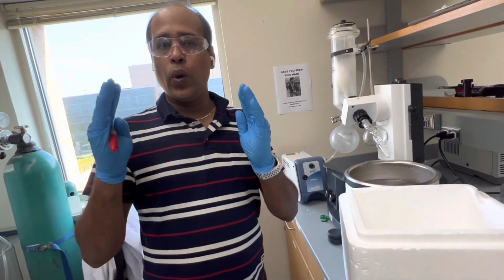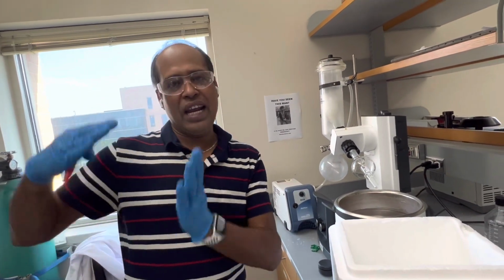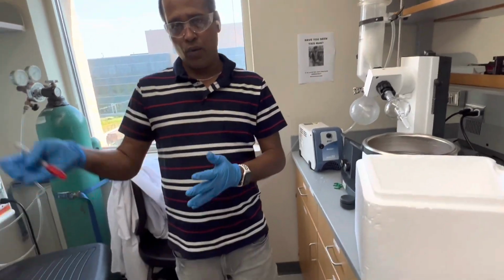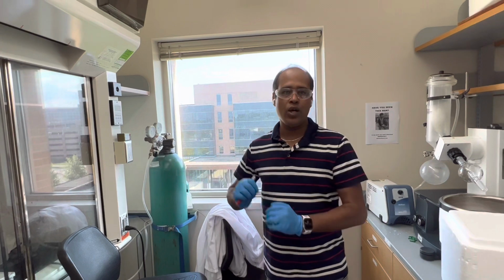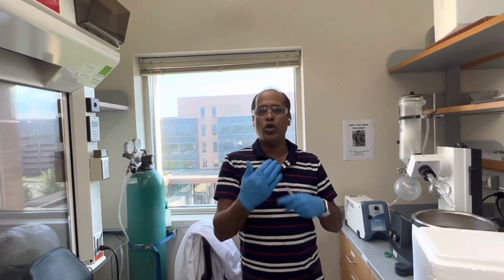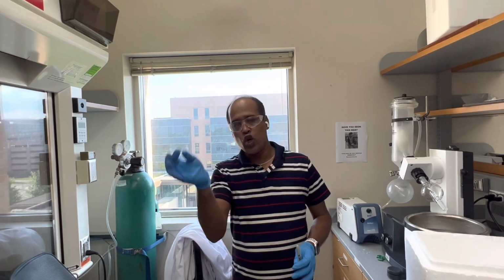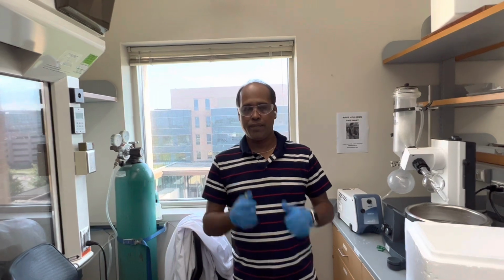Whenever you have a gummy liquid reagent added in excess, even if your compound is supposed to be solid, it may not be solid, or may not stay solid, and when you try to filter, it can be washed out with the solvent and the other liquid reagent. That's why sometimes you cool down the system, do the trituration, and then you get the solid and immediately filter it, and once it is filtered, that solid will not go back to liquid again. Does it answer your question? Yep, it's perfect. Thank you. Okay.